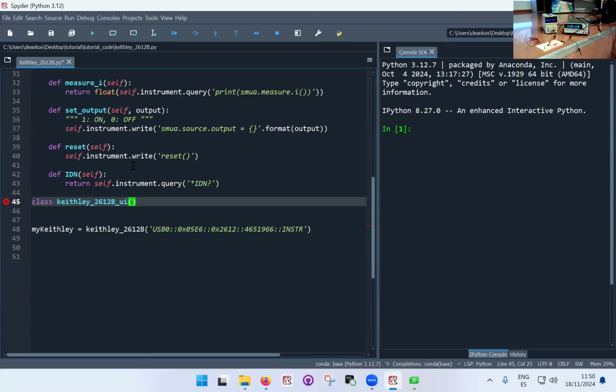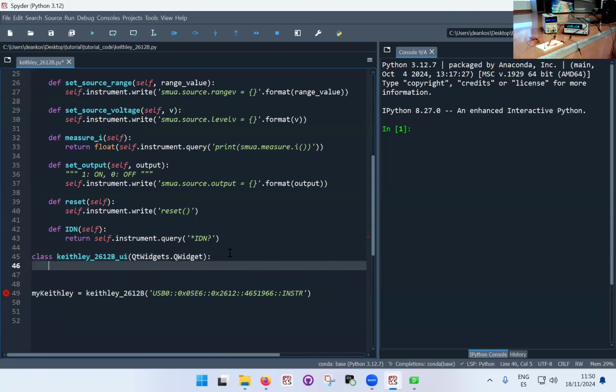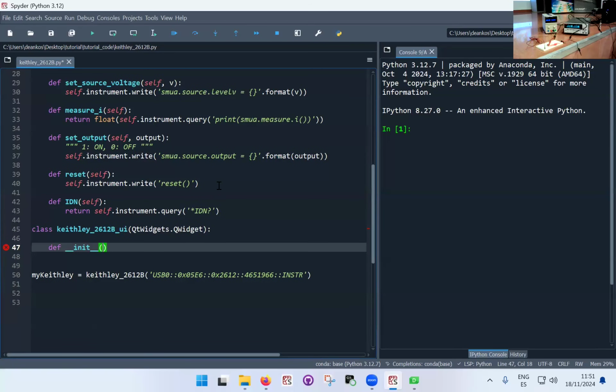So here I'm going to put Qt widgets dot QWidget. QWidget is what I want. There it is. It's auto-completing with some brackets. So Qt widgets.QWidget, and that's what I imported up here. Okay, so this is the class, and now same as before, I need to put in place the initialization of the class, and here I'm therefore going to have this def init function. This init function is going to have a self, just as we had before.